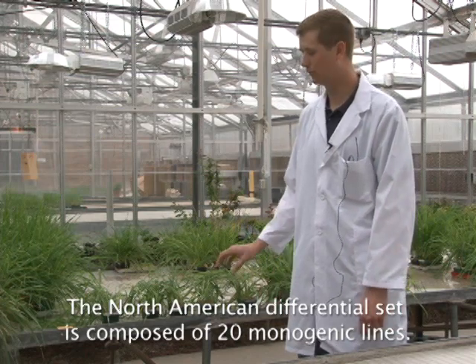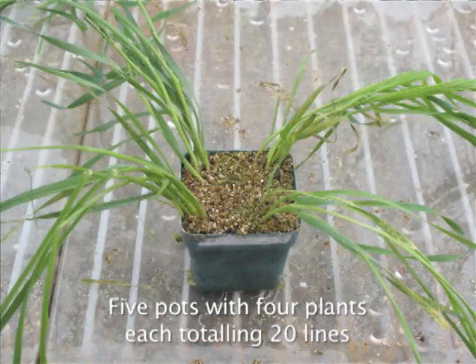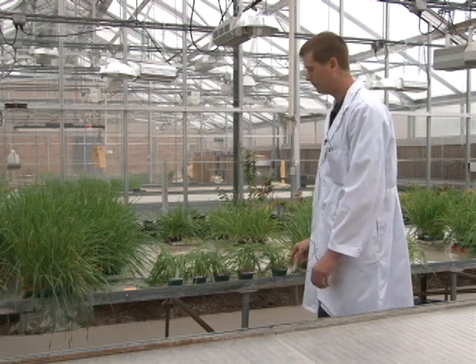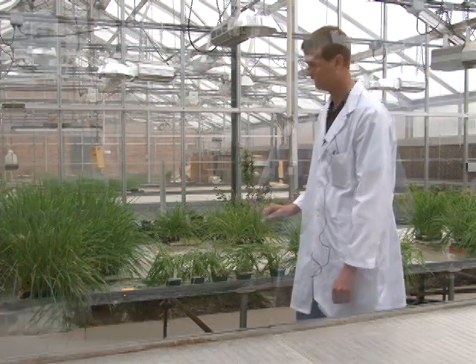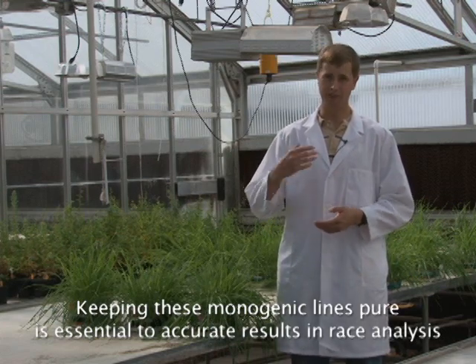First I would like to describe what race analysis is. Race analysis is simply the characterization of an isolate of stem rust on a differential set. The North American stem rust differential set has 20 different lines. Those differentials are planted into these five pots shown here, with four differentials planted in each pot. A differential is a monogenic wheat line — monogenic because it has one gene, specifically one stem rust resistance gene. Having a monogenic line allows us to see the reaction of a single gene in a wheat line, which allows us to determine the race of stem rust accurately.